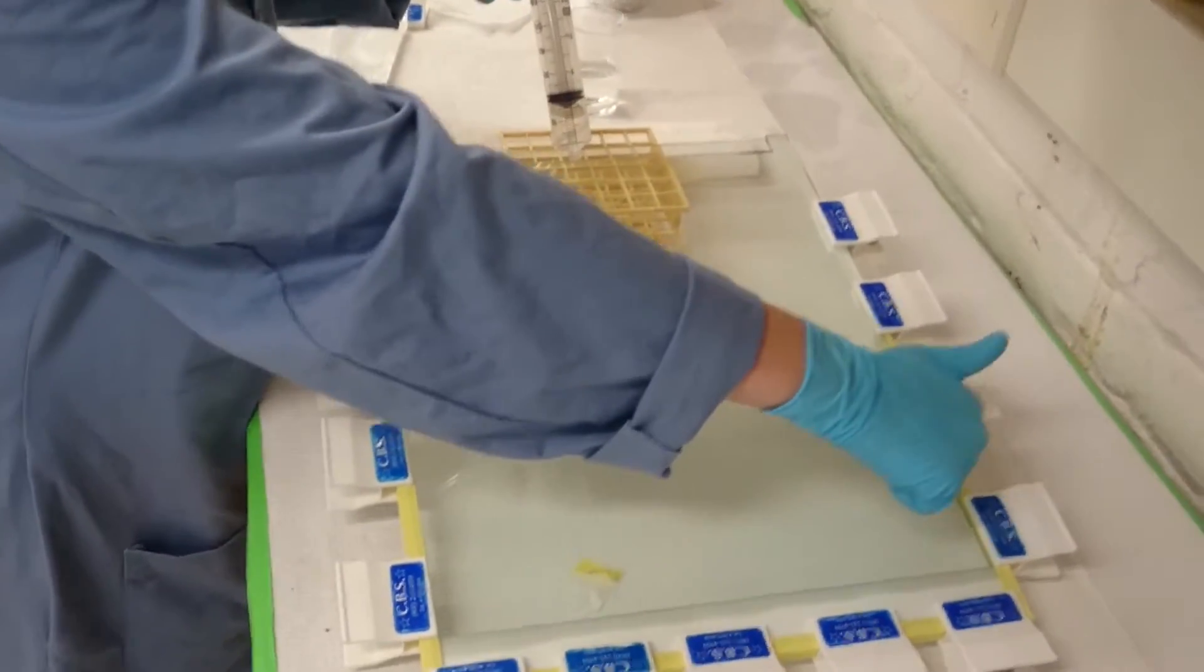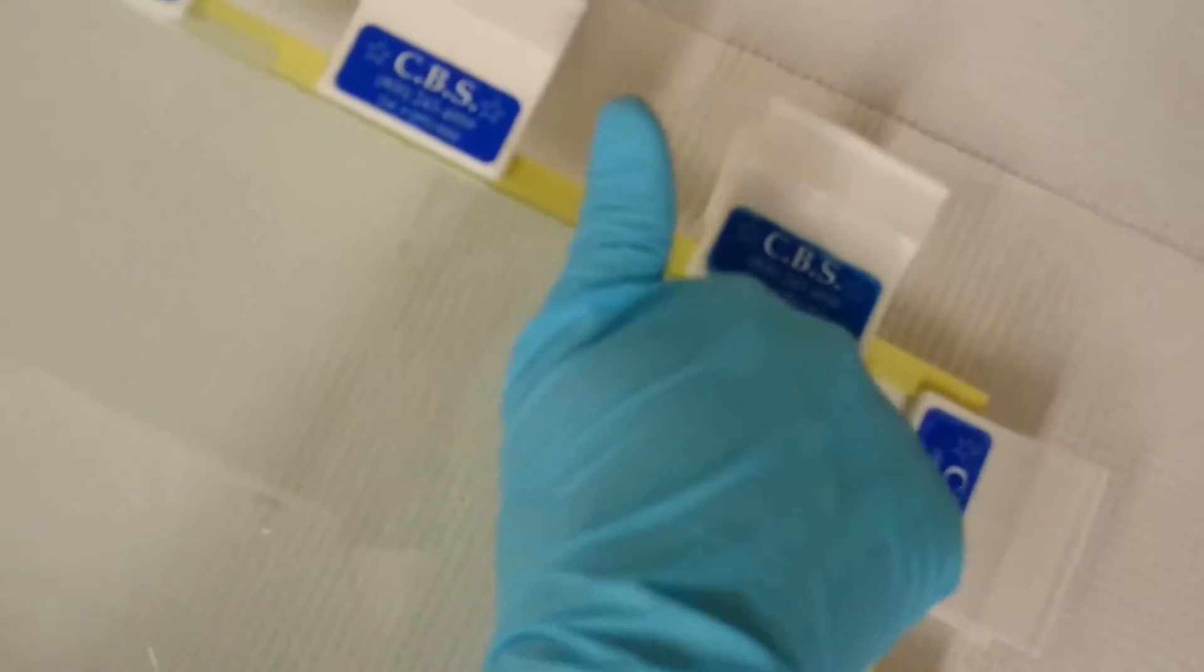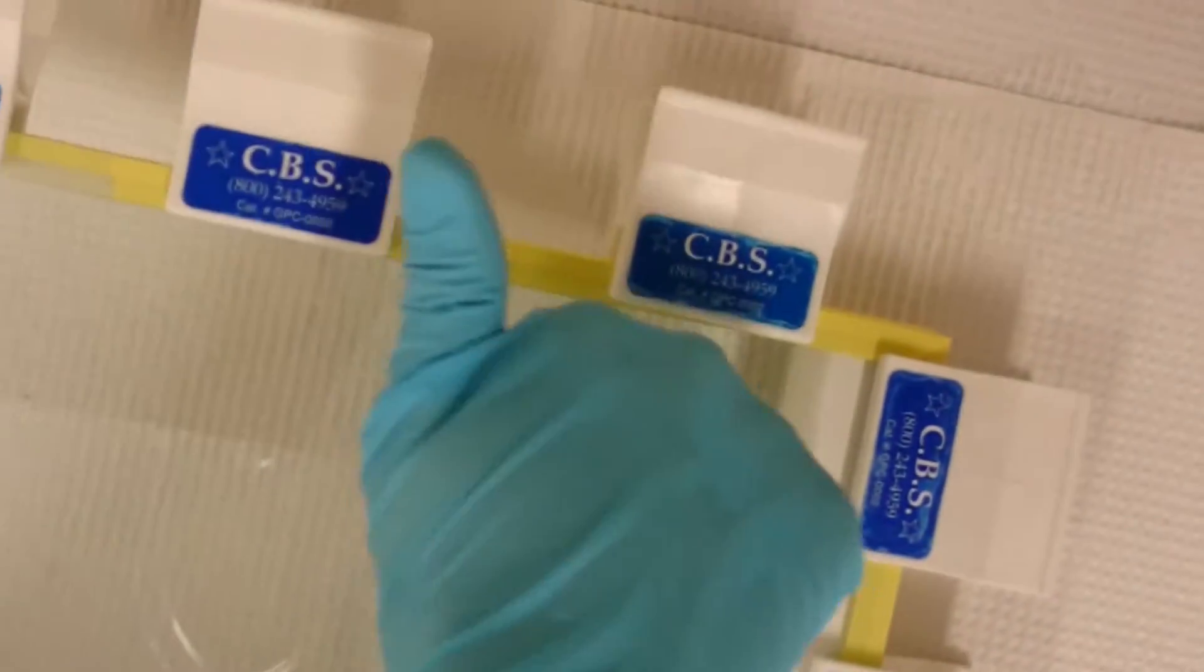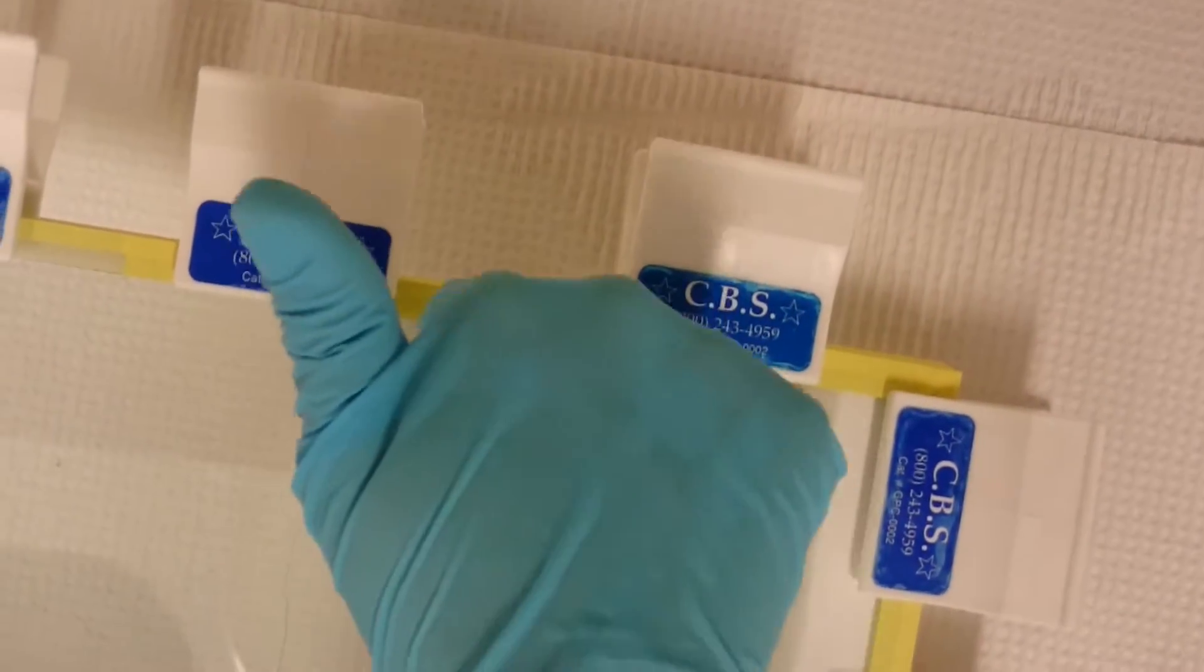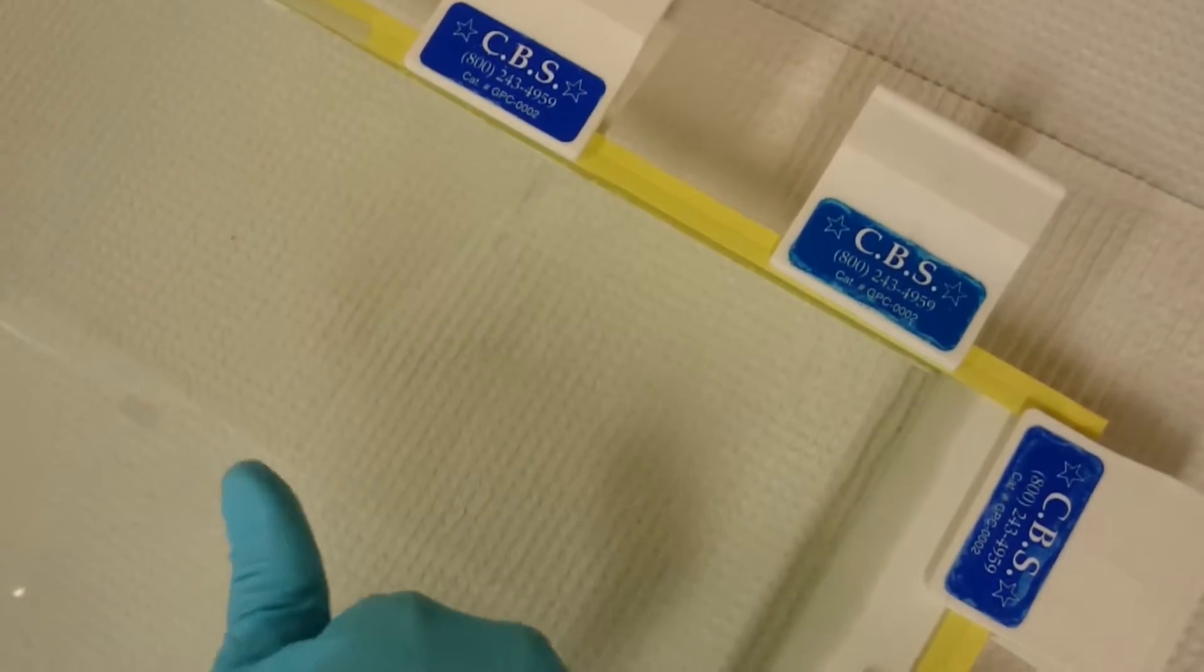You can see that the gel is getting stuck a little bit further down over here, so I'm just going to tap over there more to help it get unstuck. And the whole time I'm watching for bubbles in the area that the gel has already filled up.